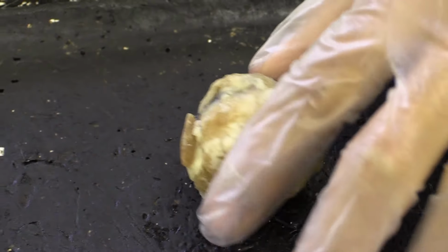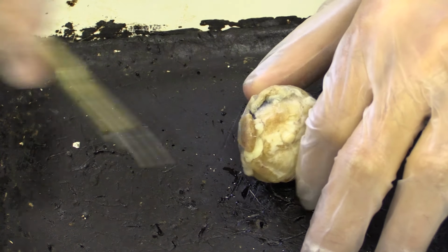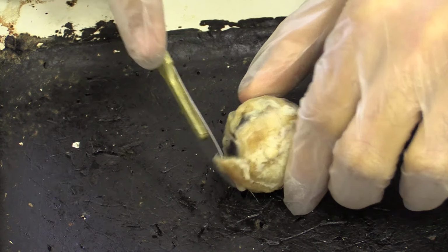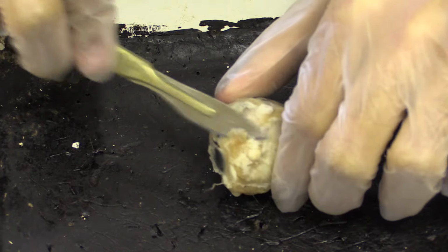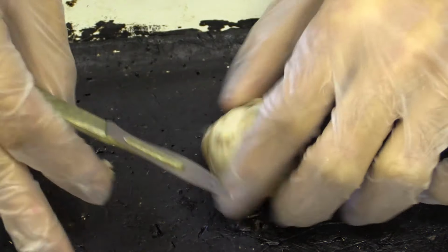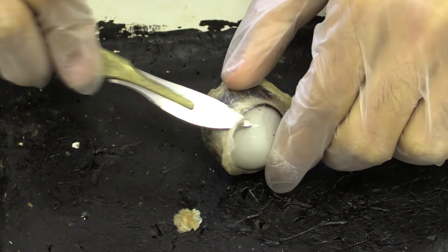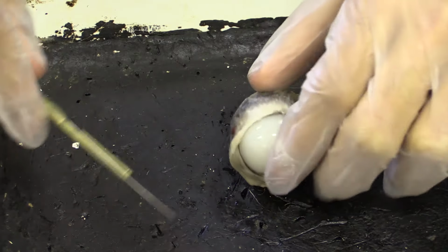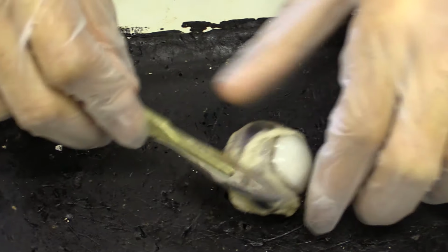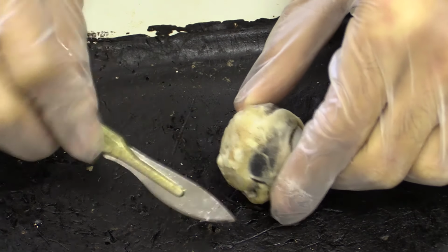So now what I'm going to do is just remove some of that periorbital tissue, and then we can get started with internal cutting. So for example, this little bit here needs to be cut off. Be quite delicate with it. This is all just fatty tissue, as I said earlier. And then we get a better feel of what the eye actually looks like with this fat removed.